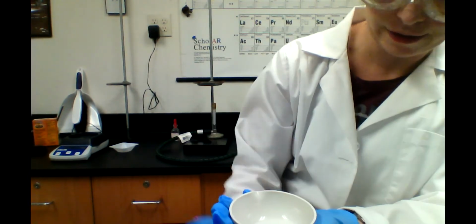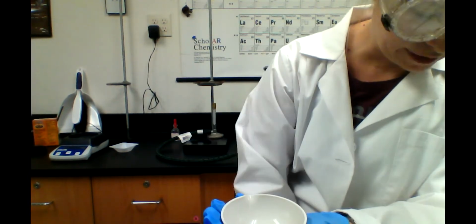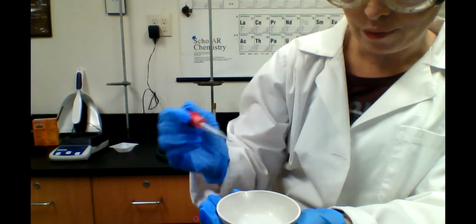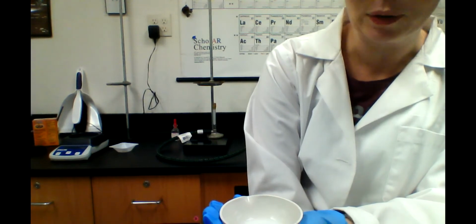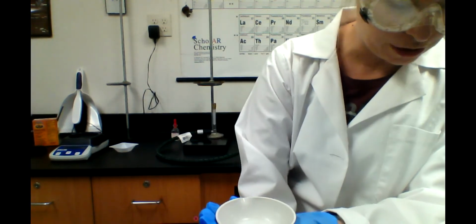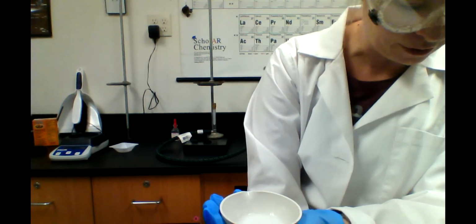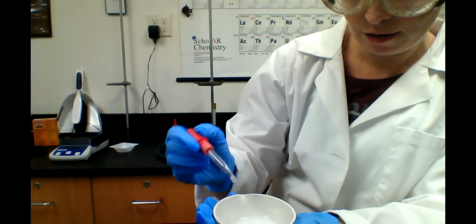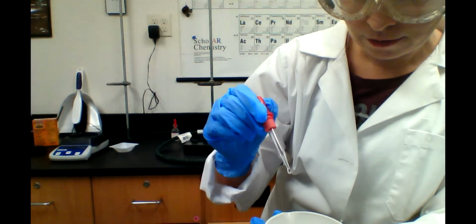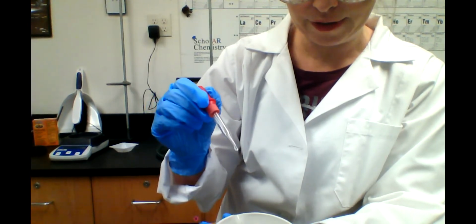This is taking a lot. And we could actually calculate, which I should have done with you guys. Maybe I'll insert that. We can calculate how much of this 1 molar that we're going to need, because the mole ratio is 1:1. So we can use our stoichiometry that we've been learning. I'm getting close. Can you hear it? Still reacting.